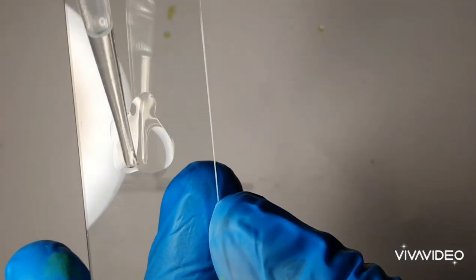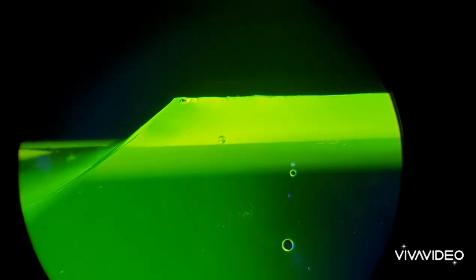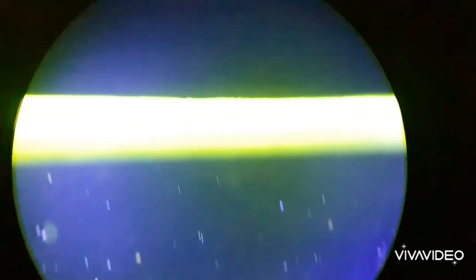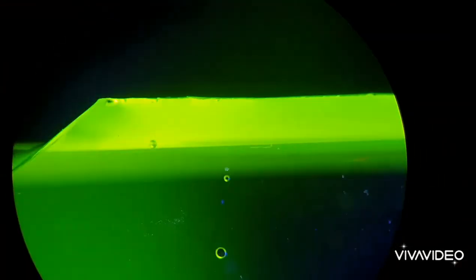So to a glass slide I added the hydrogen peroxide. I then added some of the dye and the diphenyl oxalate to the slide and was able to observe the reaction in real time. It was really cool.